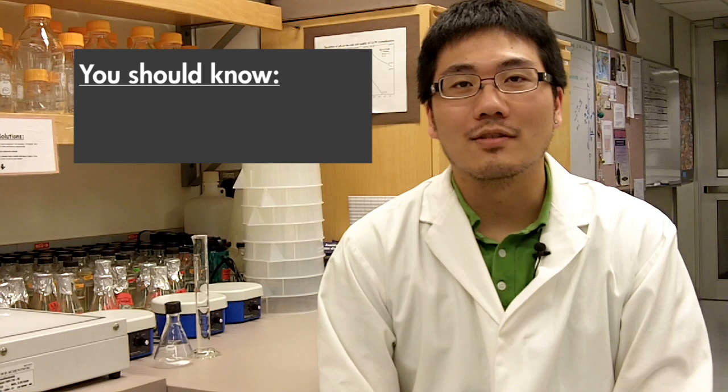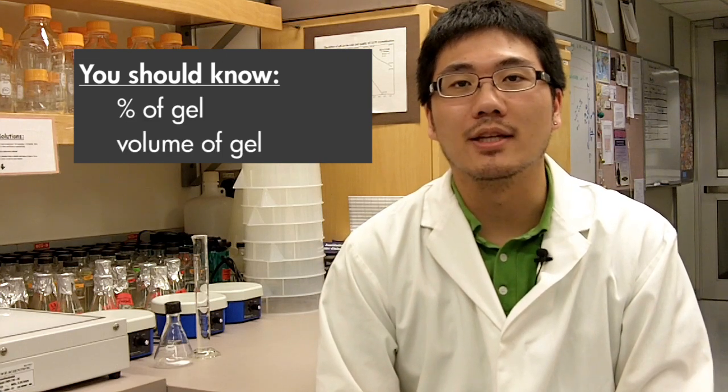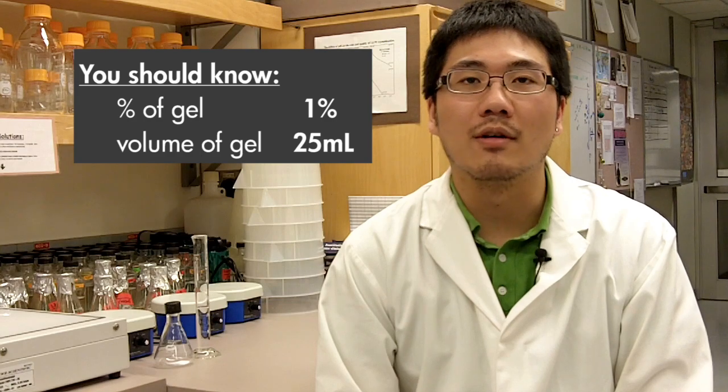Before you make a gel, first of all you need to figure out what percent you're making and how much you'll be making. Today I'm going to make 25 ml of 1% gel.